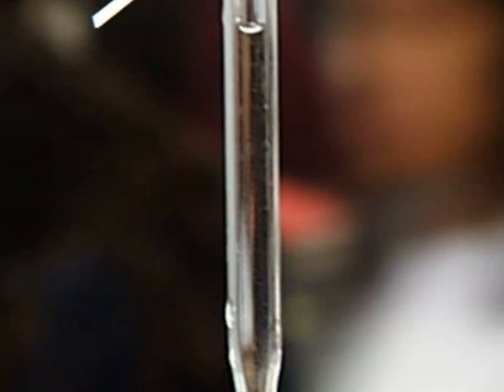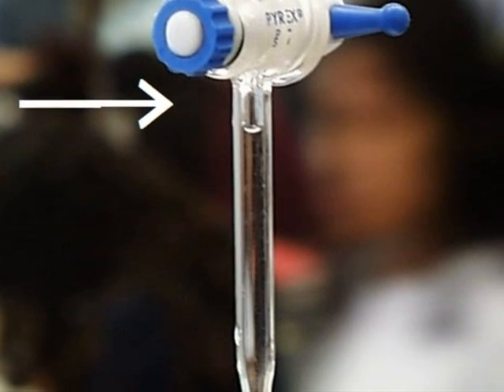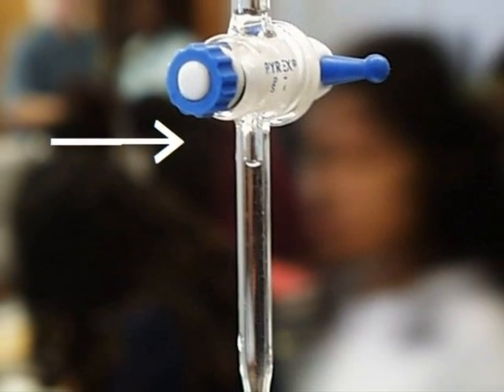Before starting the titration, be sure to expel air bubbles from the tip. They may be removed by quickly opening the stopcock several times. Note the small air bubble here.